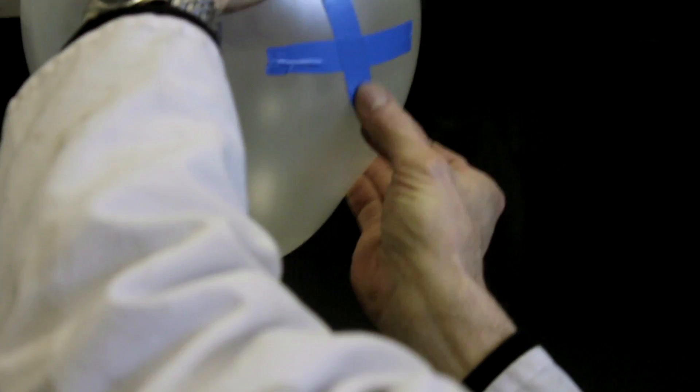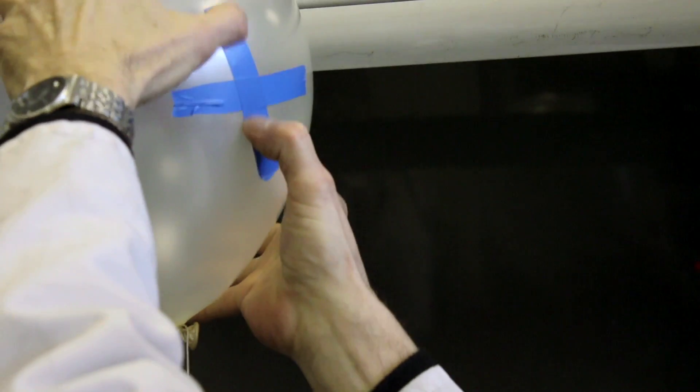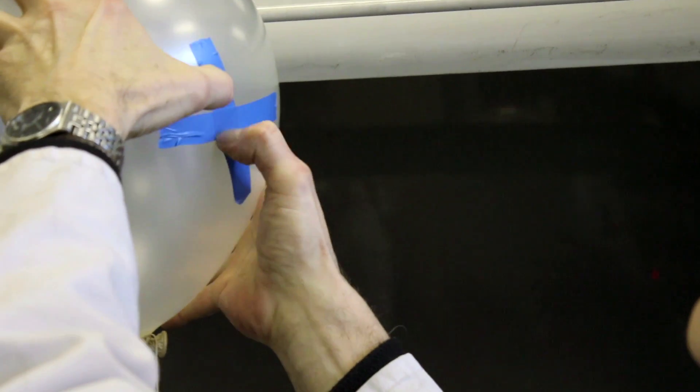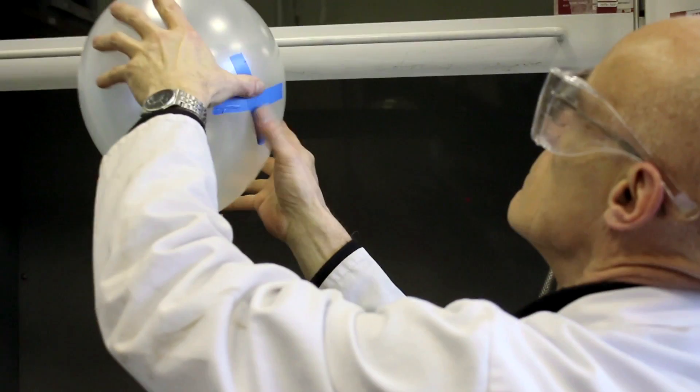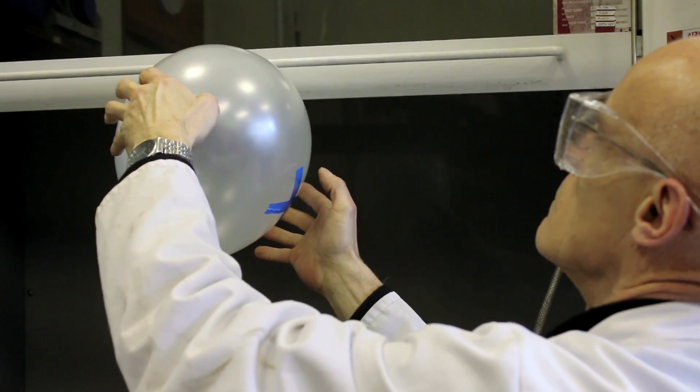Then we remembered that if you put sticky tape onto a balloon, you can then stick a pin or a needle through the tape into the balloon without bursting it.